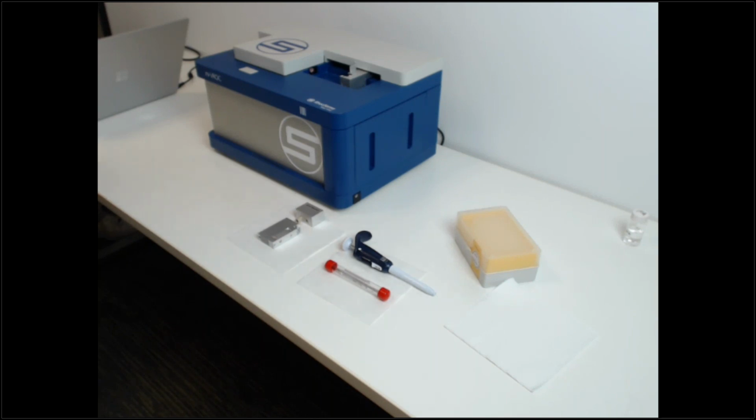And so some of our clients like to see, is there impact of shear on their molecule? Can their molecule withstand high shear rates seen in injectability, manufacturing, filtration? And so you don't have to devote a lot of sample volume to do those types of tests to see if there's any impact on the structure of your sample.